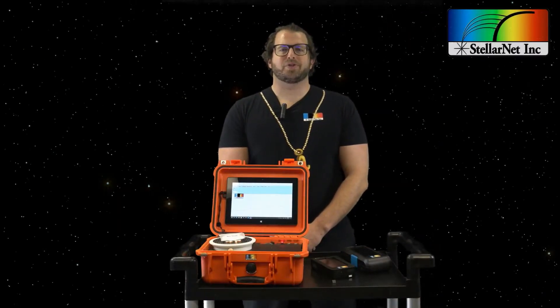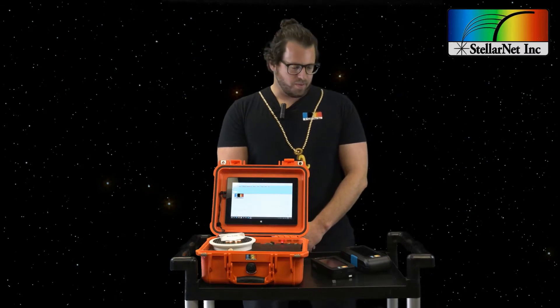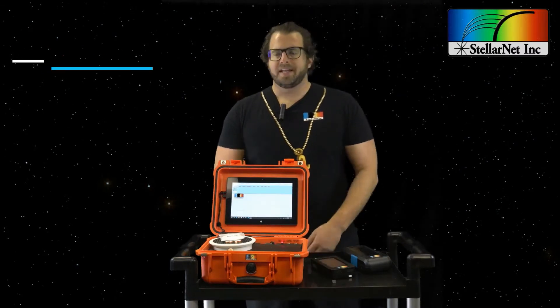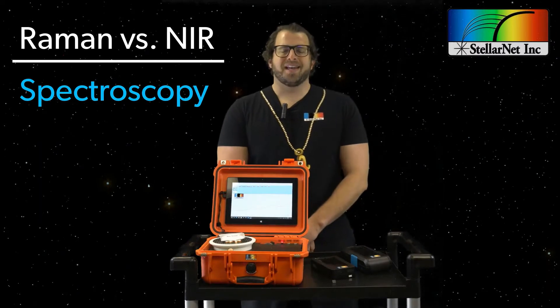Hi, my name is Jason Pierce and I'm the president of StellarNet Spectrometers. In this video we're going to discuss some of the differences between Raman and near-infrared spectroscopy.